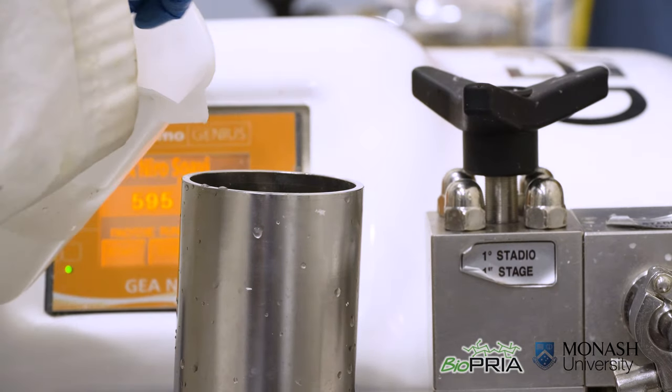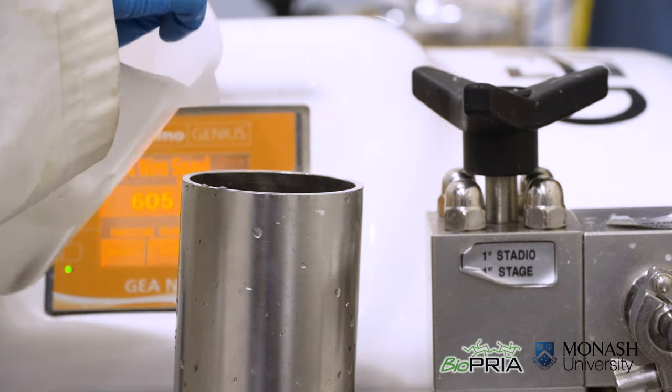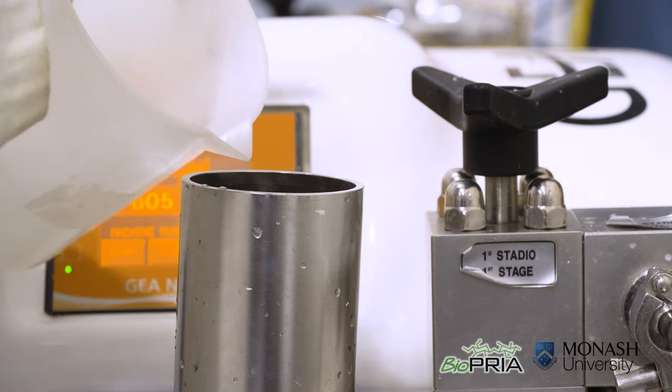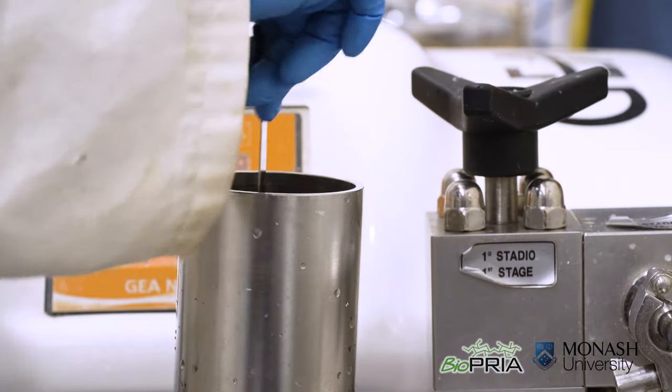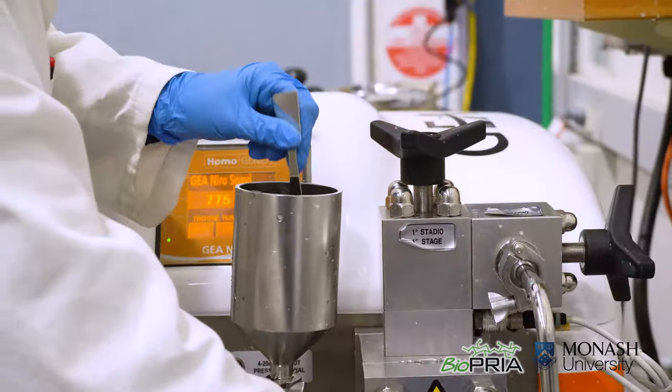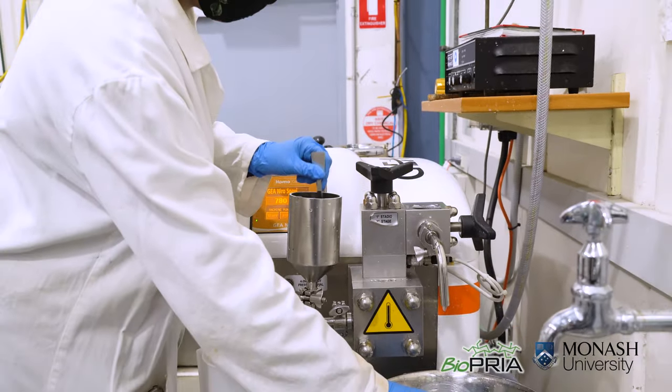Before the water runs out we prepare the cellulose suspension and immediately pour it in the homogenizer. Make sure to keep on stirring as we pour in the cellulose suspension. Now we collect our nanocellulose gel.